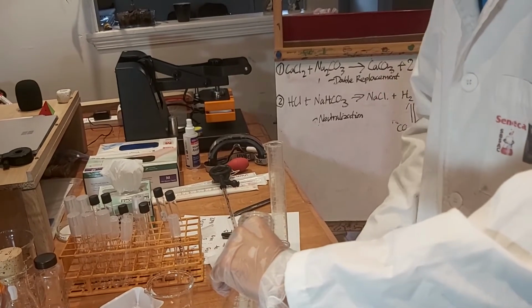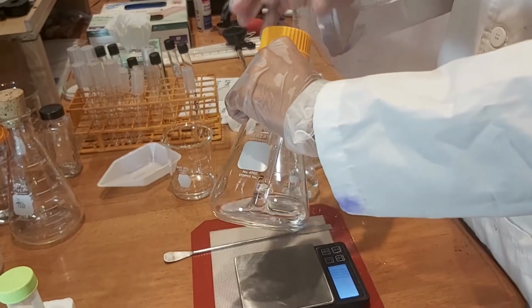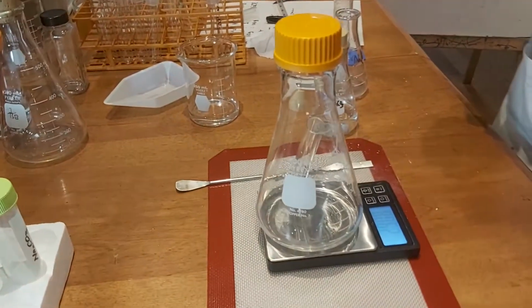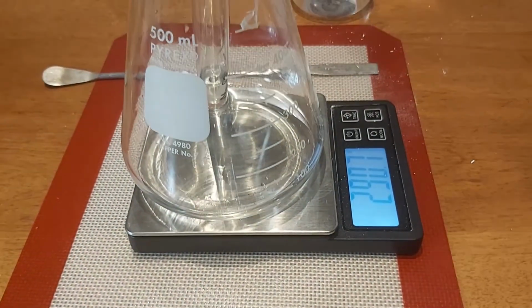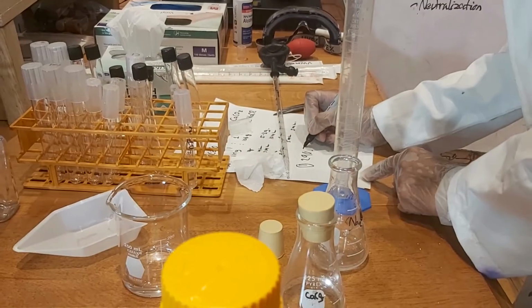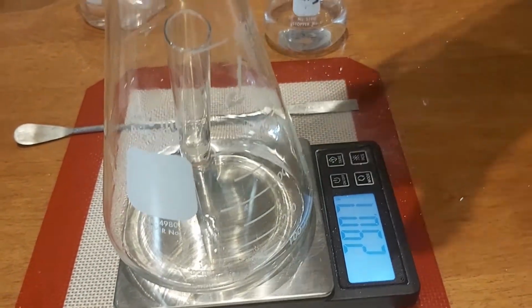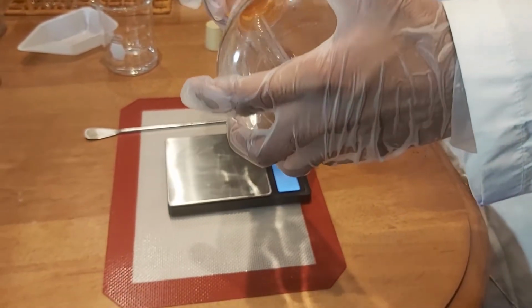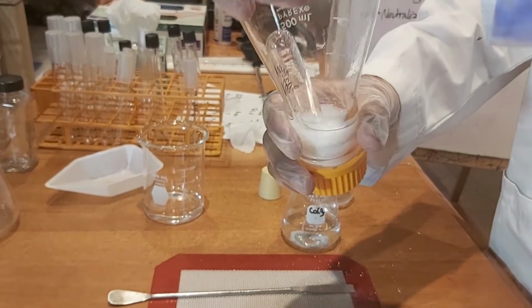Turn on the scale. First, keeping on the lid to make sure the system is closed. Now measuring the mass of the total apparatus. We have 290.7 grams for the beginning. So for experiment 1, we have 290.7 grams before the reaction, and now we're going to turn the whole apparatus upside down to see how the reaction will occur. This is tightly sealed.